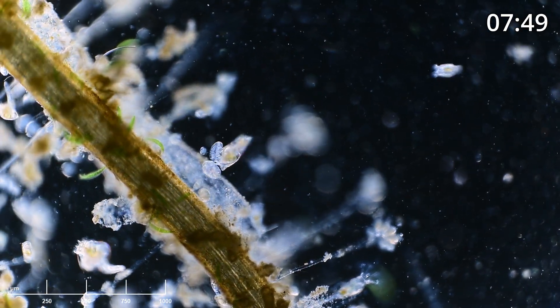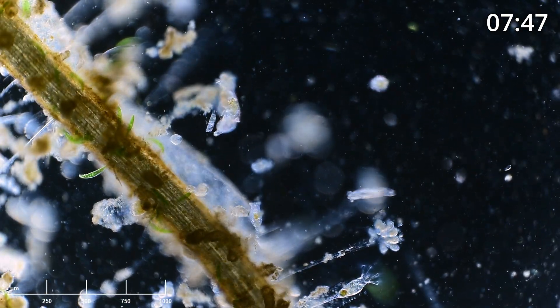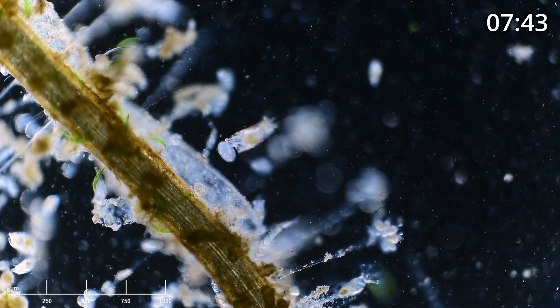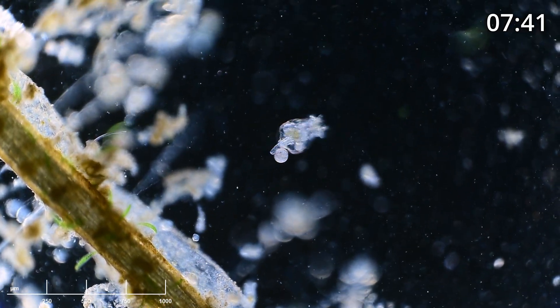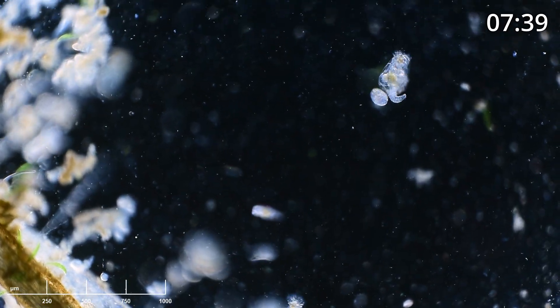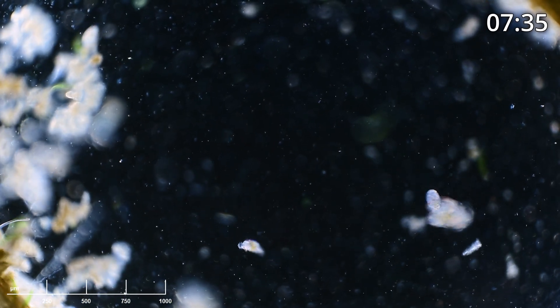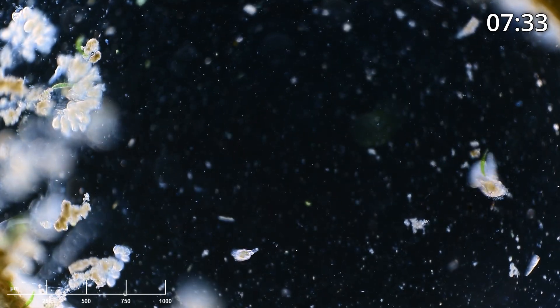Here we have a free-swimming rotifer, and this rotifer has an egg attached outside of its lorica — outside of its shell, if you will. You'll probably notice a lot of these with eggs swimming through the environment as we look around.